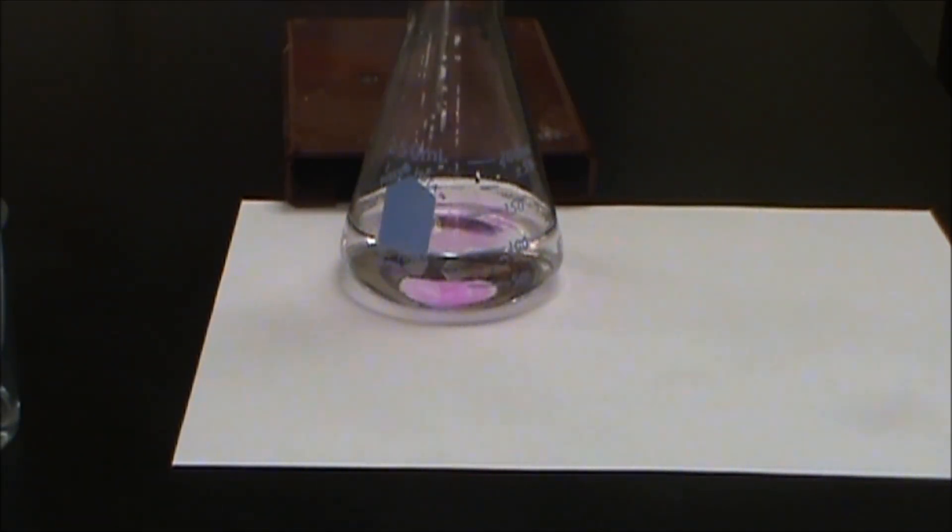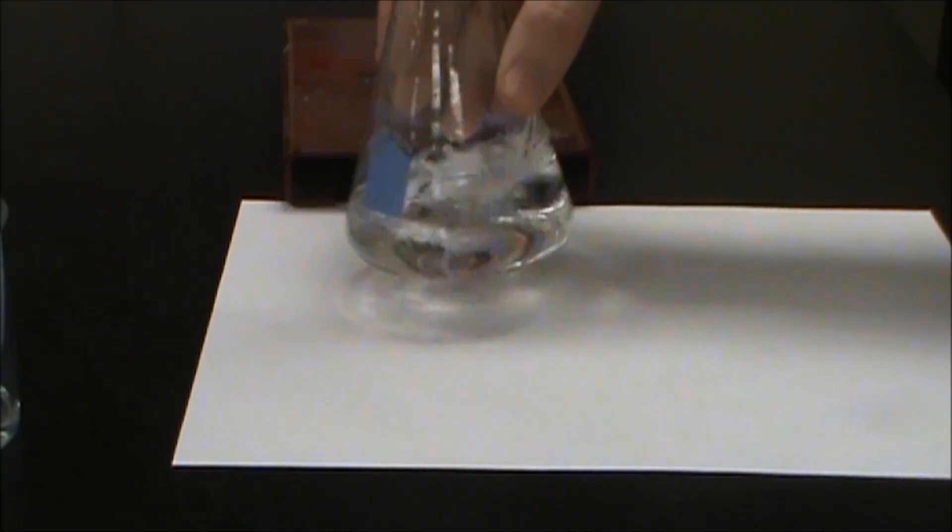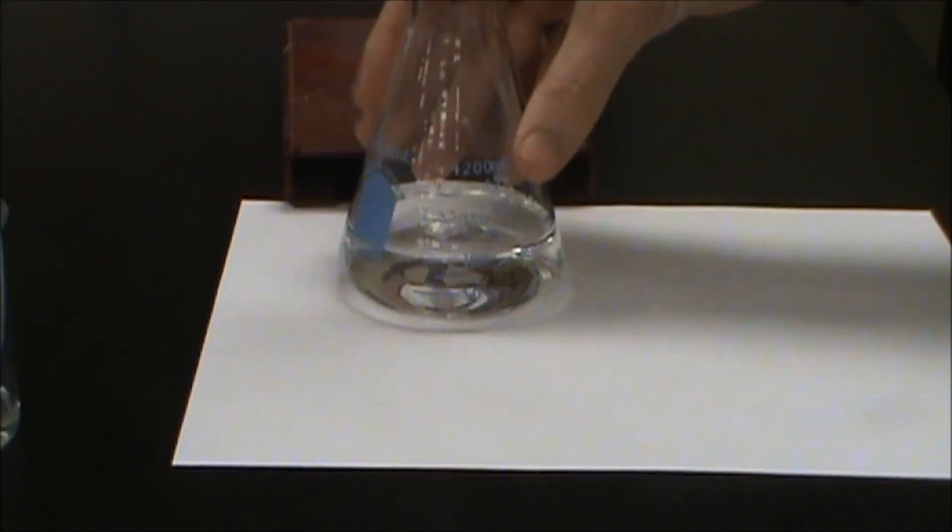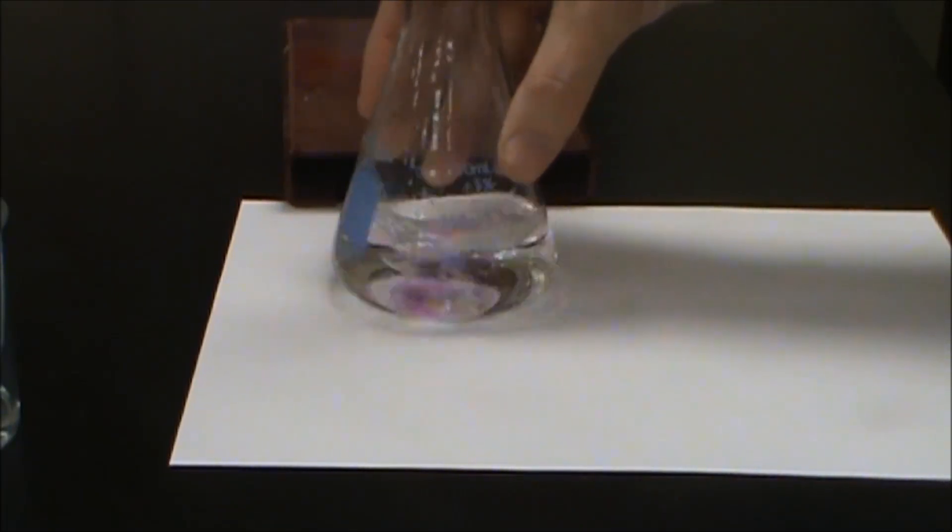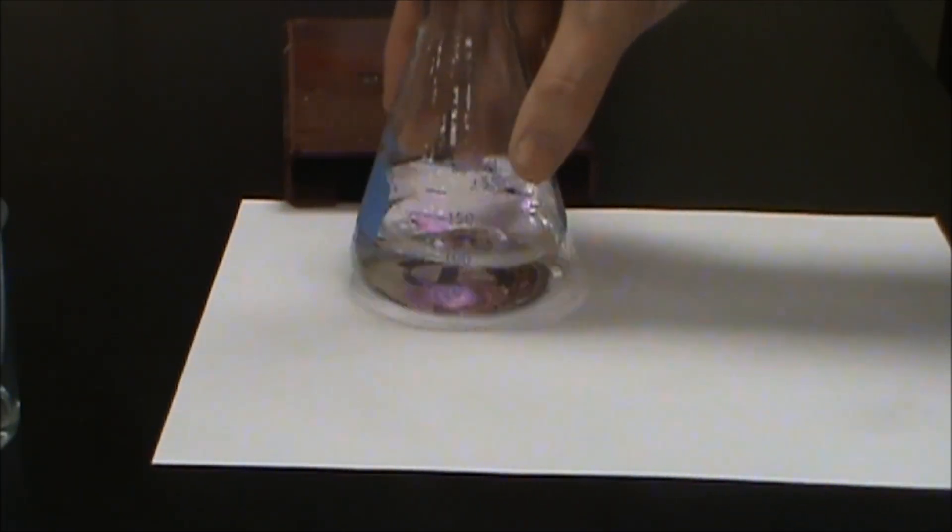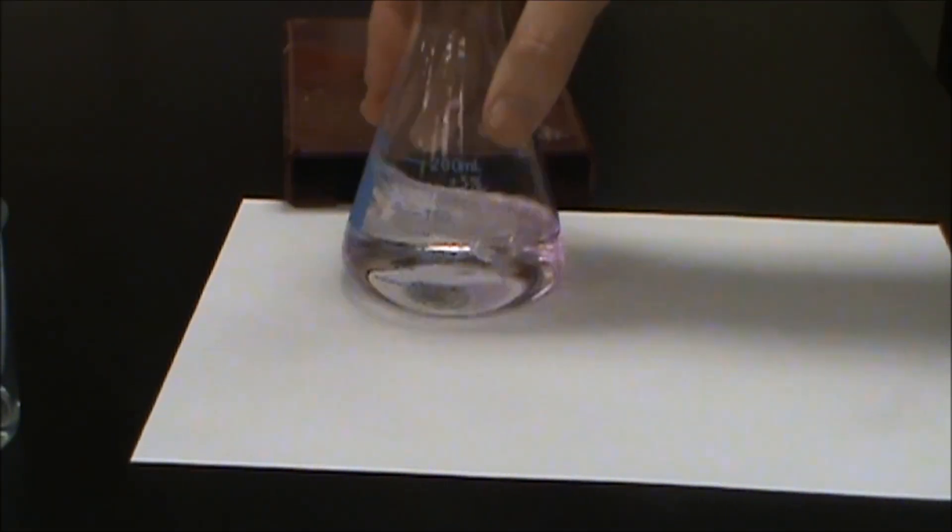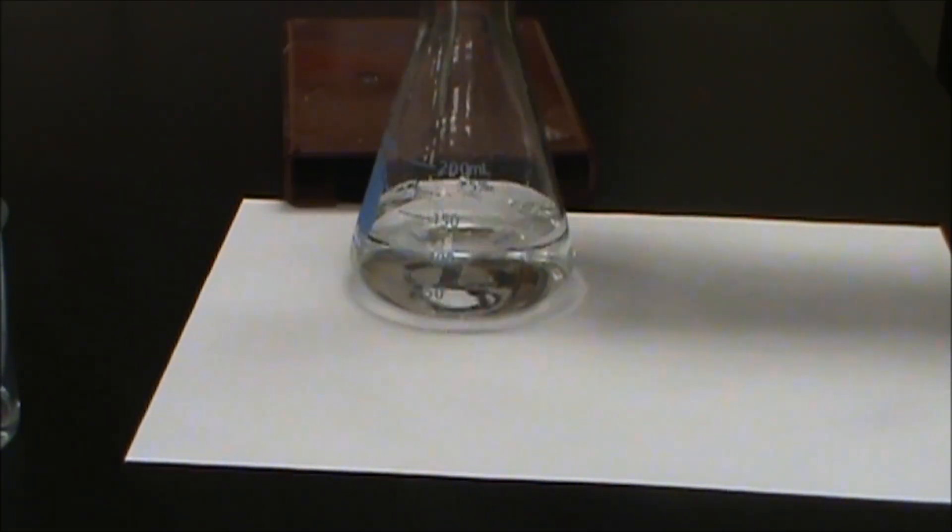All right. So at this point we're getting close to the end point. Or we should be. So we're now going to slow this down a little bit. Start to do a few drops at a time. Make sure we don't get that pink color persisting.